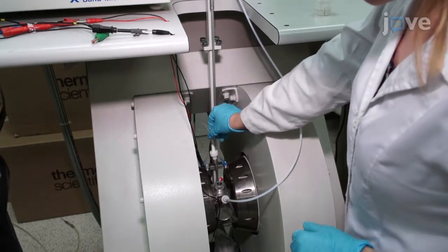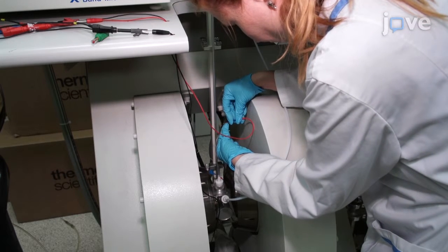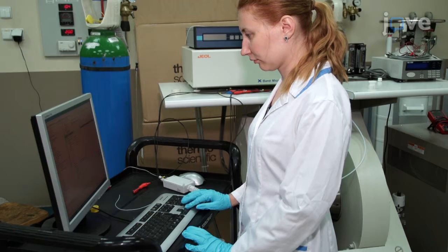Connect the electrodes to a potentiostat and place the cell in the instrument. It is critical to set up the spectroelectrochemical cell properly and not destroy the film deposited on the working electrode surface. Incorrectly placing the working electrode makes it impossible to register any results. Apply a neutral potential and acquire an initial spectrum.